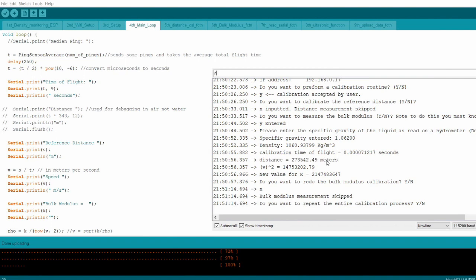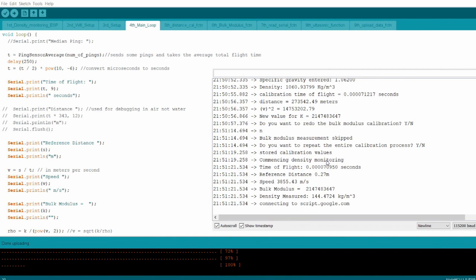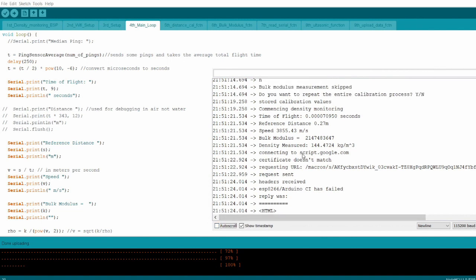Okay, so now that we're happy with our calibration so far, we can begin measuring the density. So here we go. It takes a density measurement once every 10 minutes thereabouts. Here you can see the first density measurement has been taken. It tells us the time of flight, which is just the time it takes for sound to travel from one side of the rectangle to the other side. You see that's very quick, and it's traveling a distance of 0.27 meters.